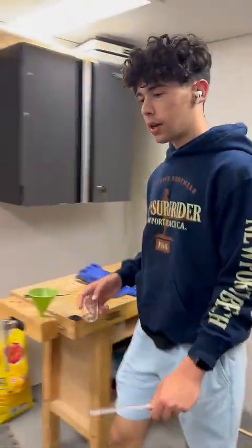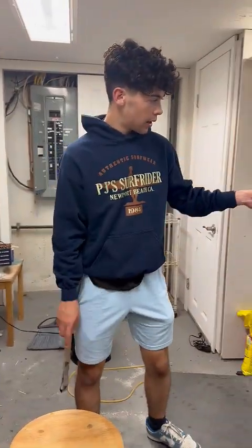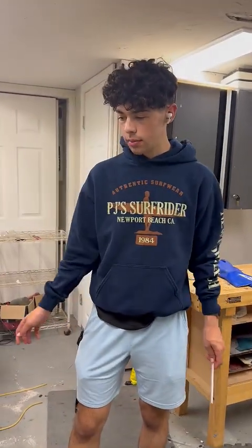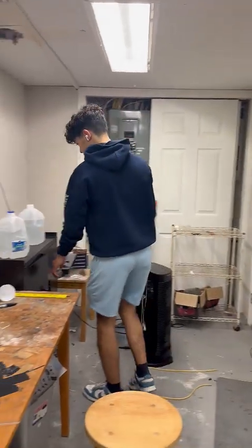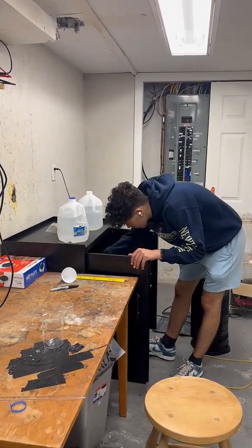Okay, so I'm going to be making sulfuric acid, and I already have a big ginormous solution of my reactants that I made yesterday. So I just want to show the chemical reaction that goes on here on a smaller scale. So it's oxalic acid and copper sulfate.